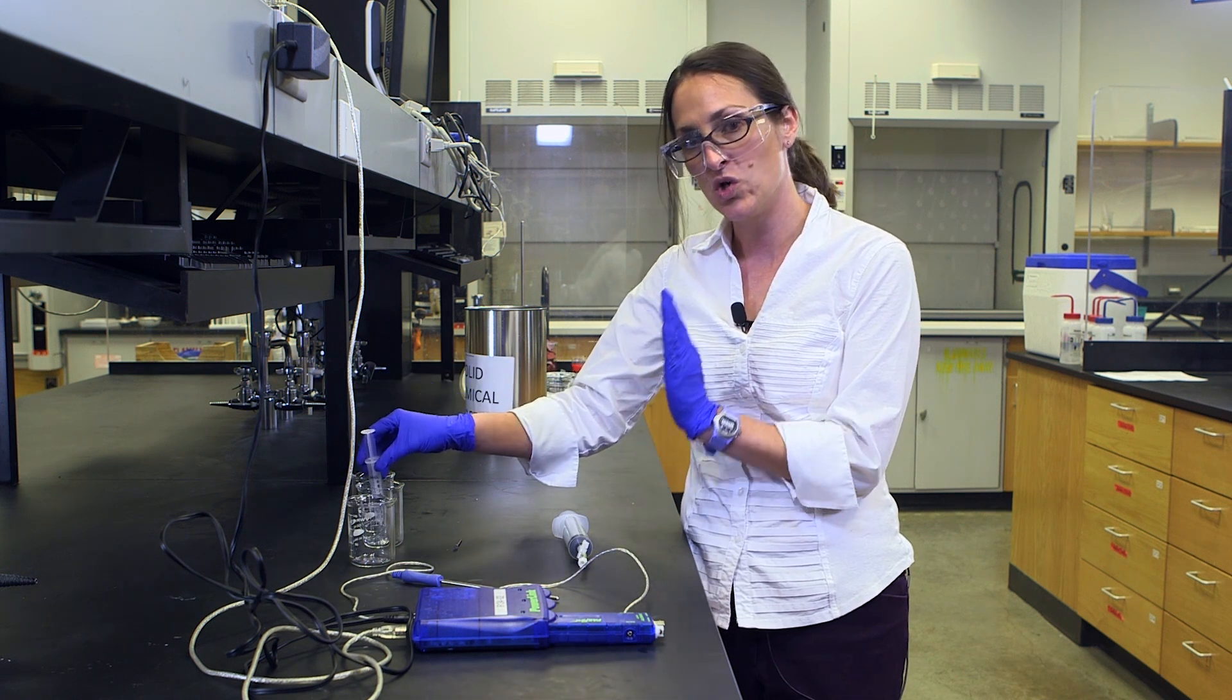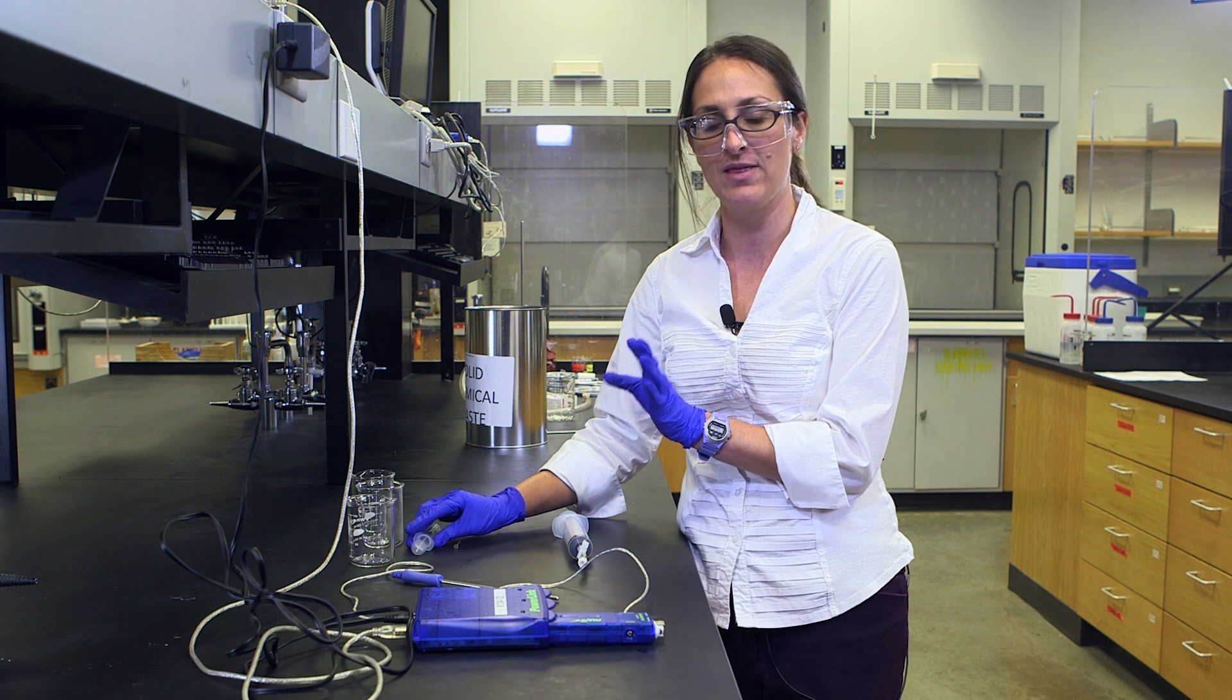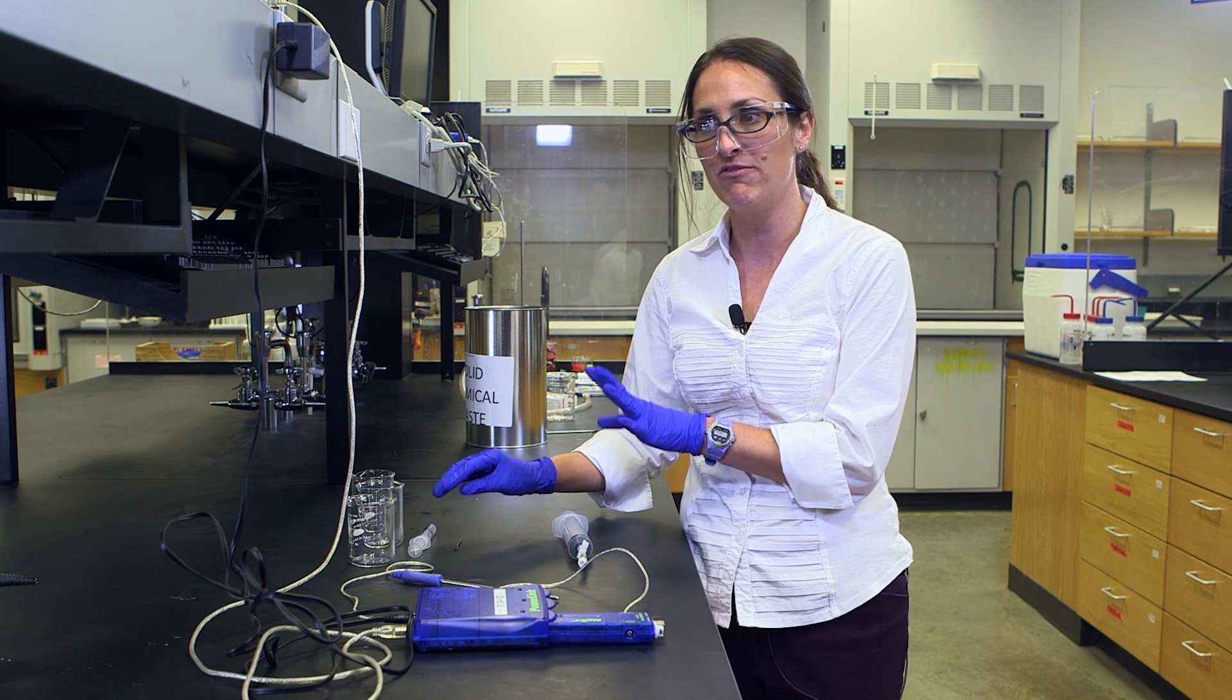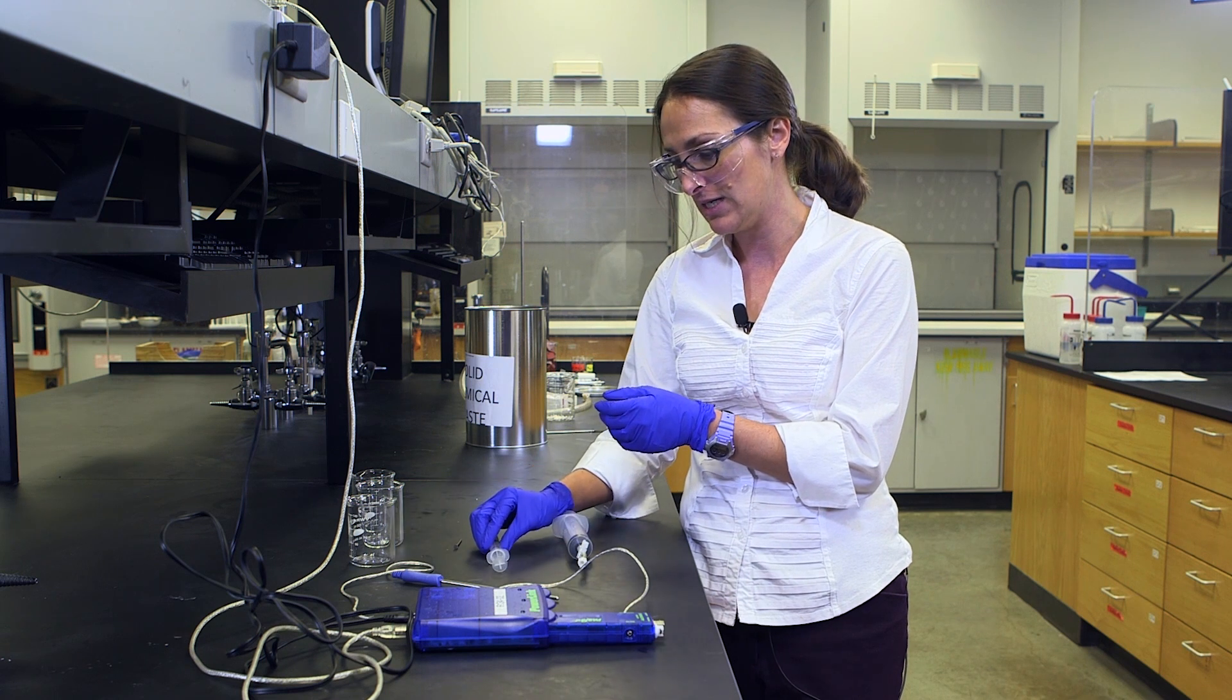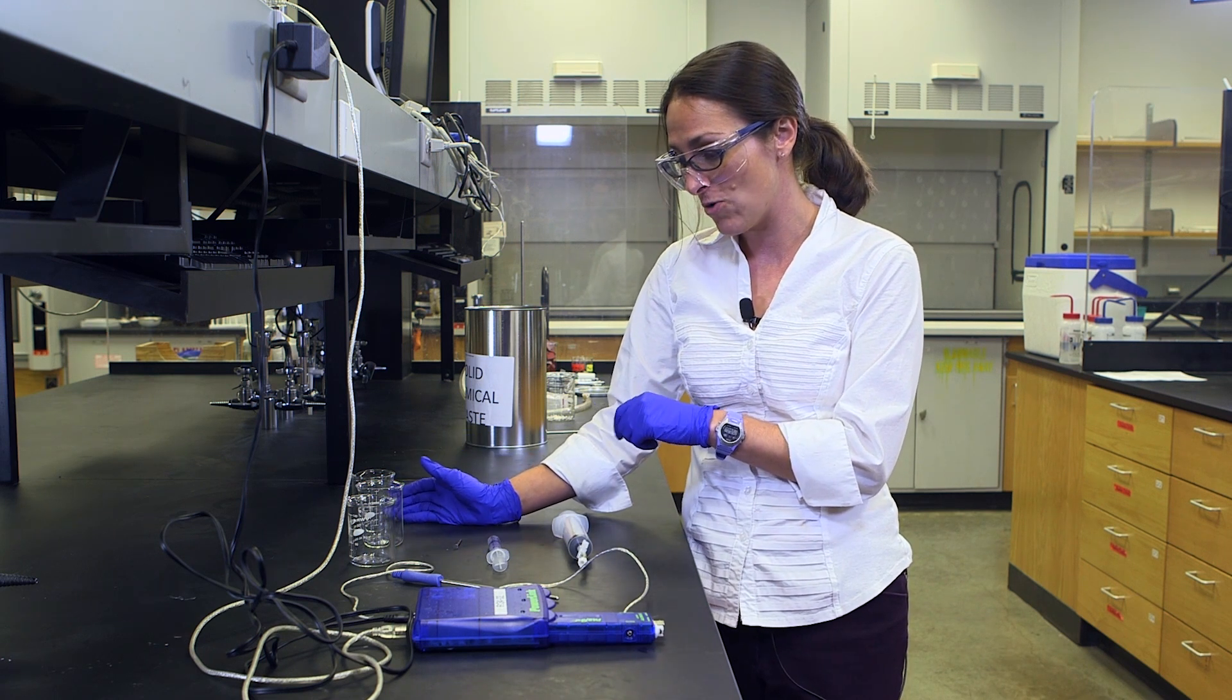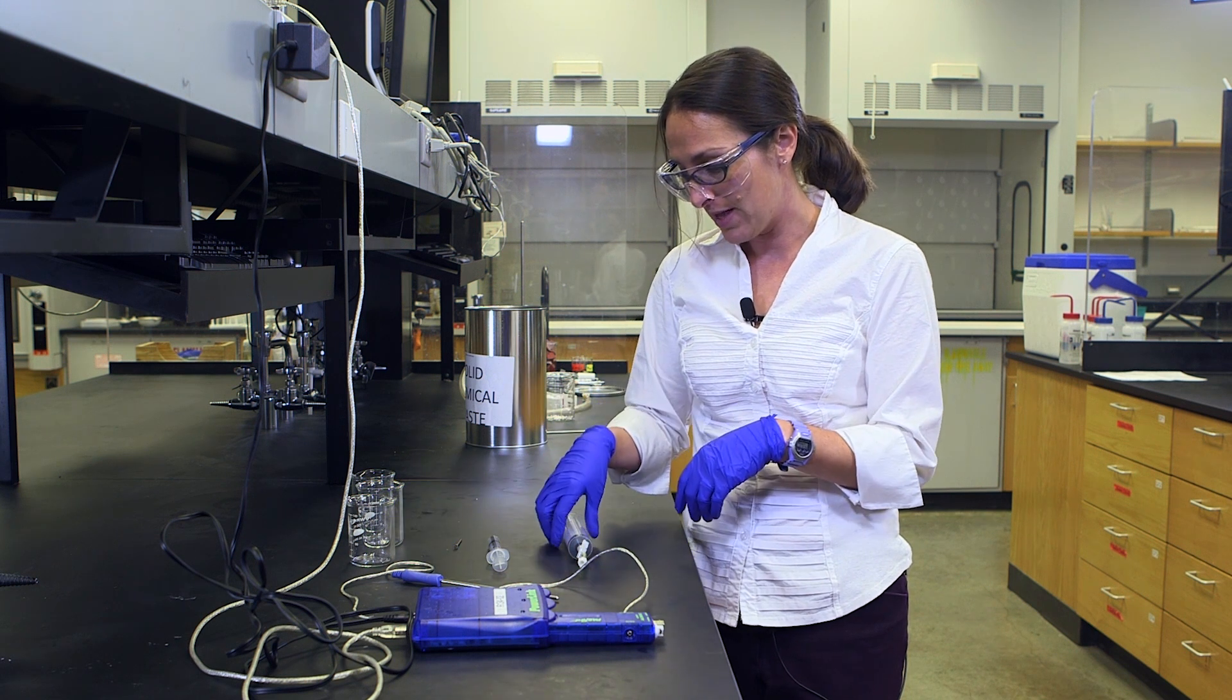You'll move it to your cold water bath and your dry ice acetone bath. Probably the biggest difference you'll see in volume will be between the ambient temperature volume and the dry ice acetone bath, because that's so much colder.